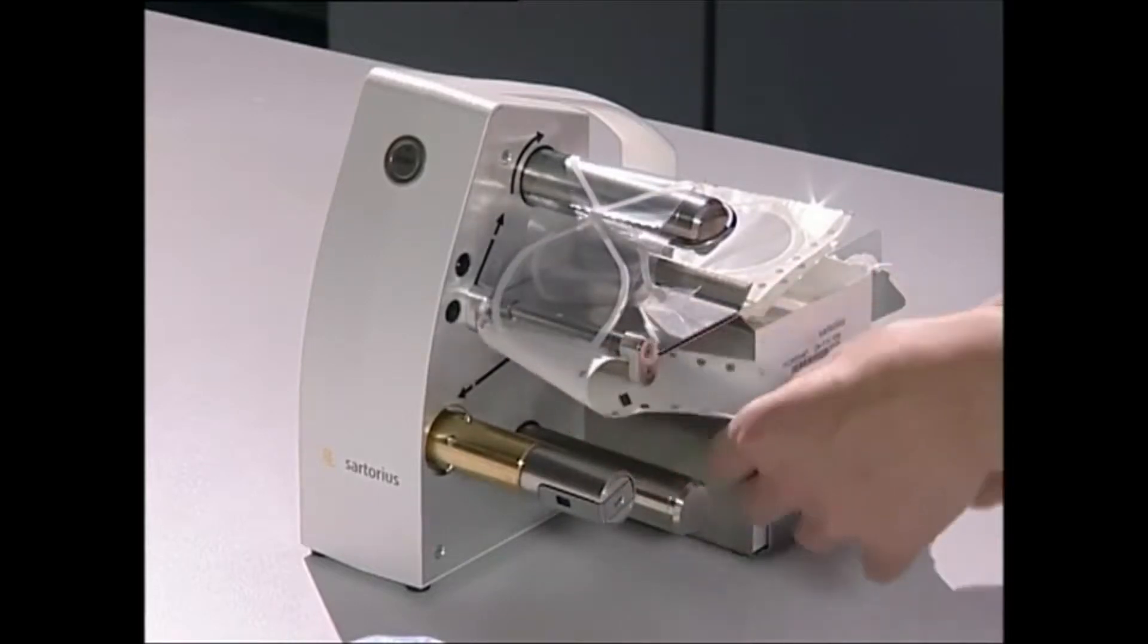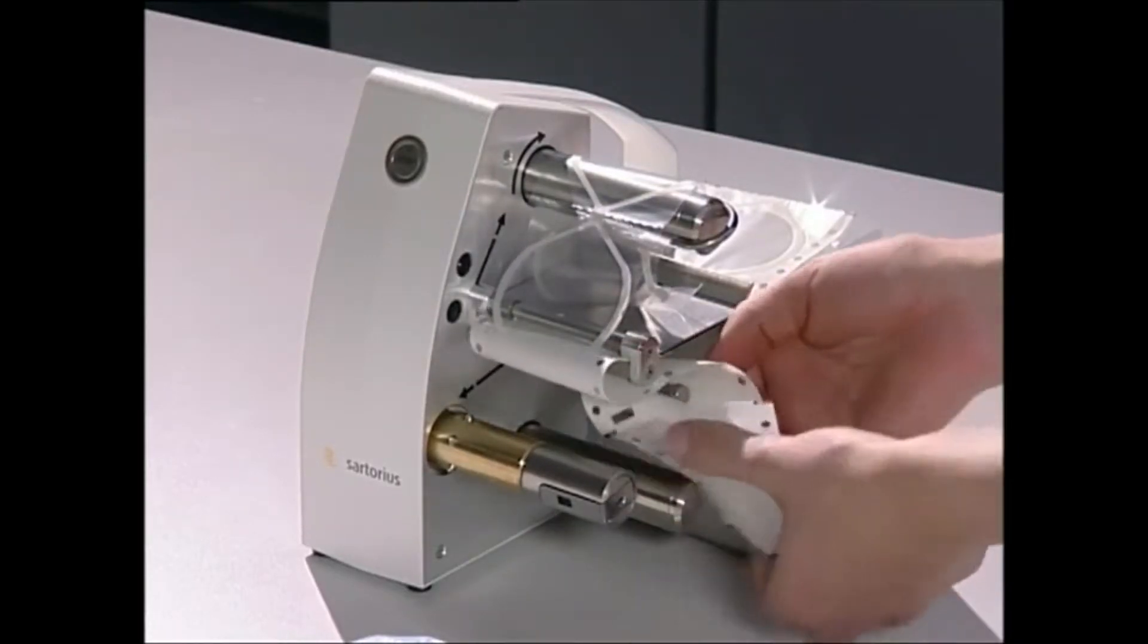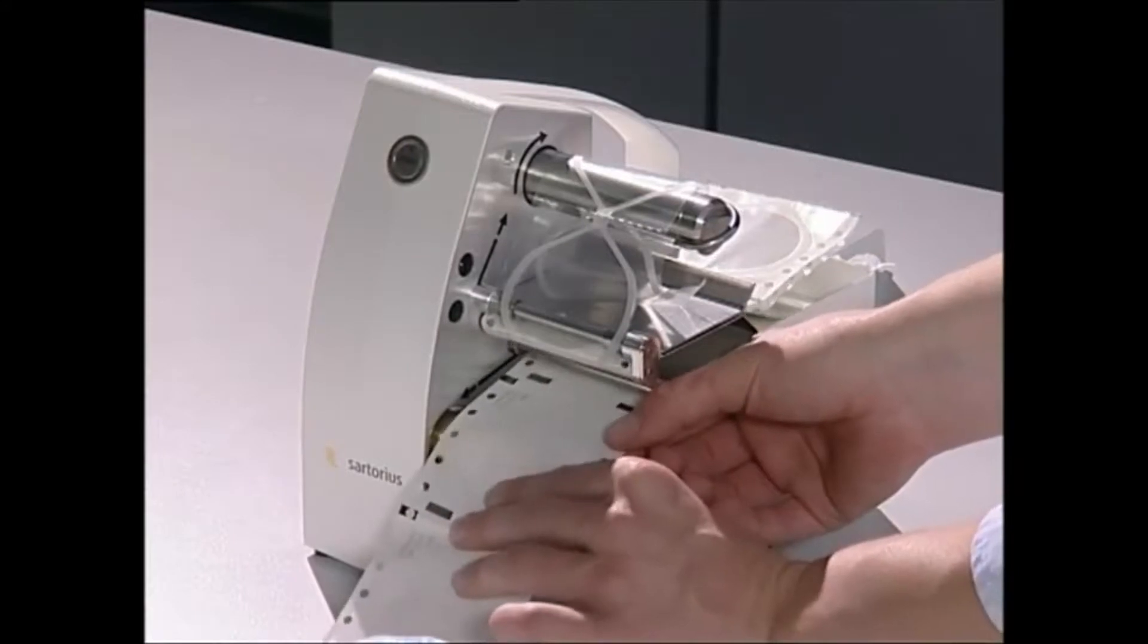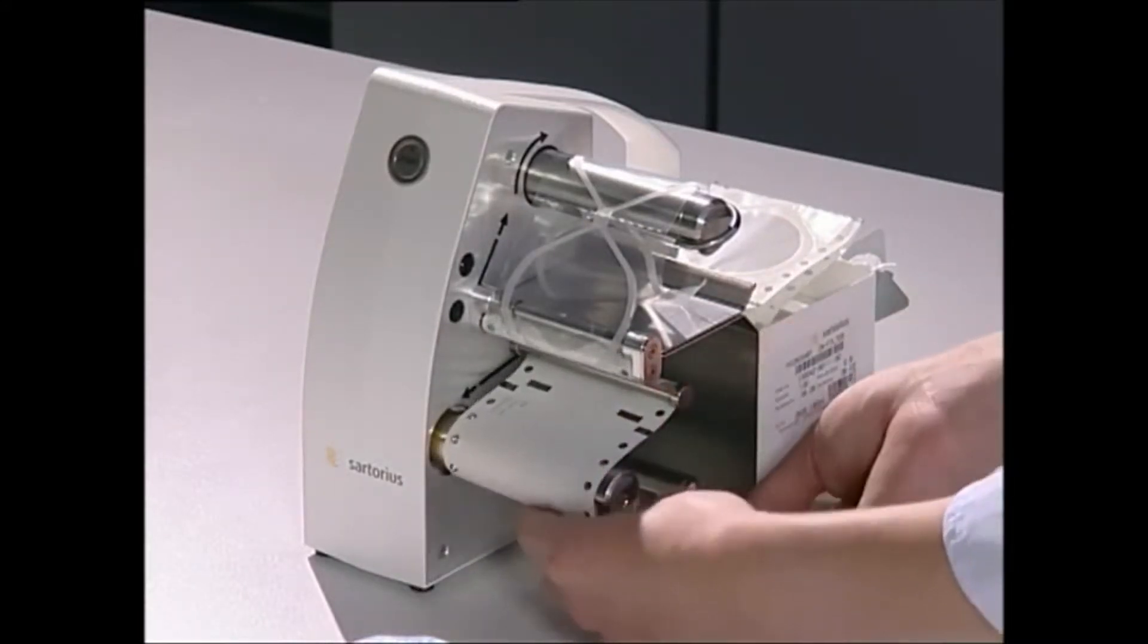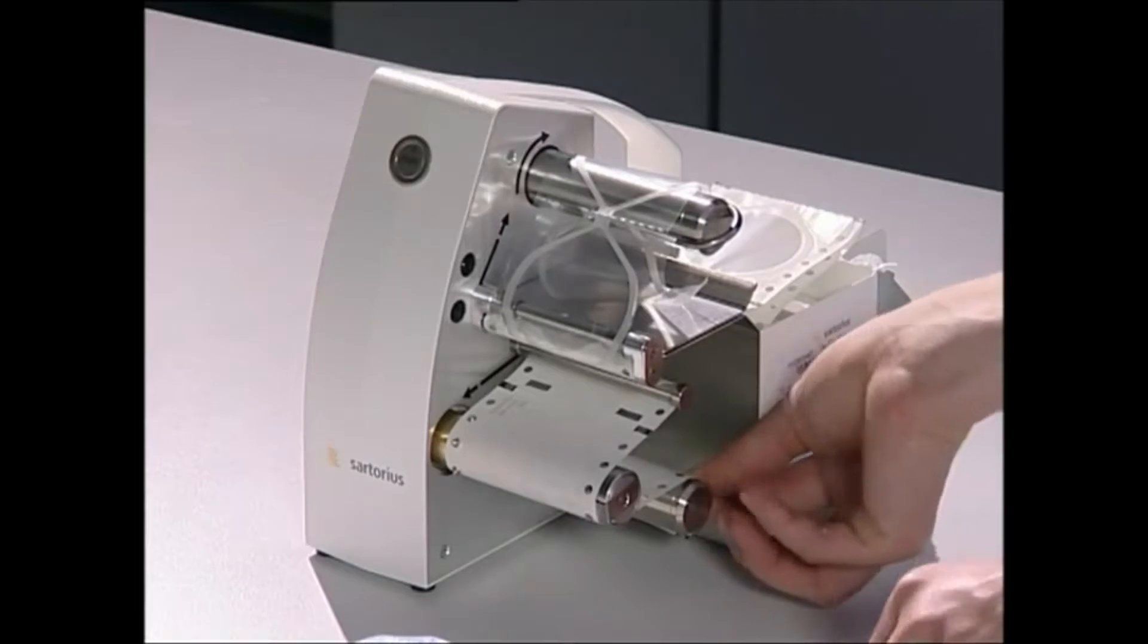Guide the paper strip around the diverter rod and the guide roller to the bottom winding roller. Make sure that the pins of the guide roller are engaged in the tracking holes of the paper strip.